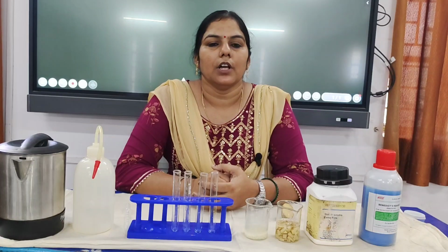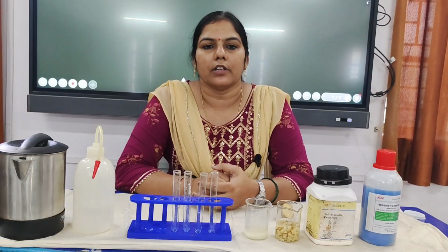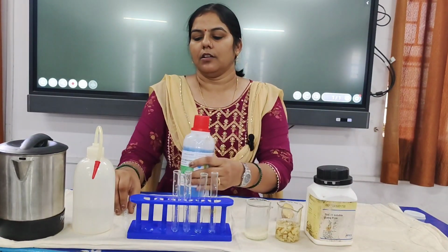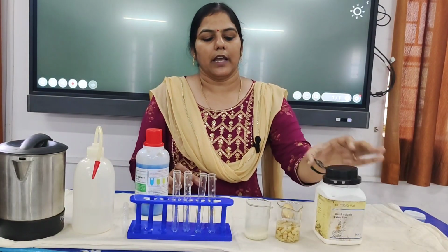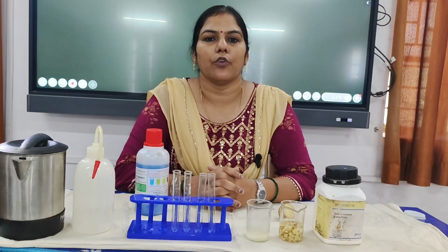In today's video, we will perform the test for the presence of carbohydrates in various food samples. For this activity, we will need the Benedict reagent, a dropper, test tubes, starch solution and food samples, for which I have taken rice and potato water.